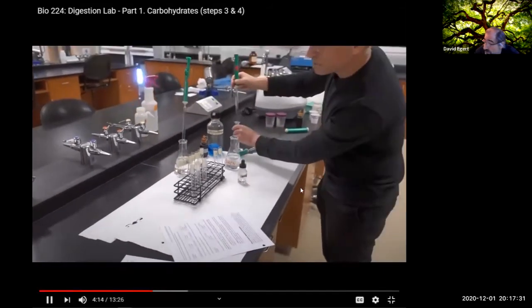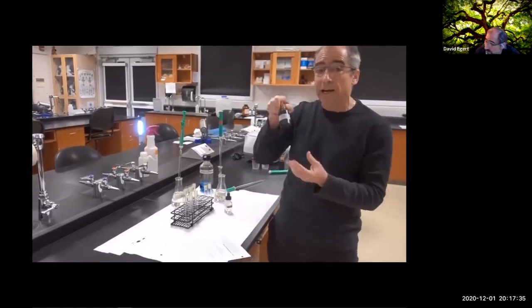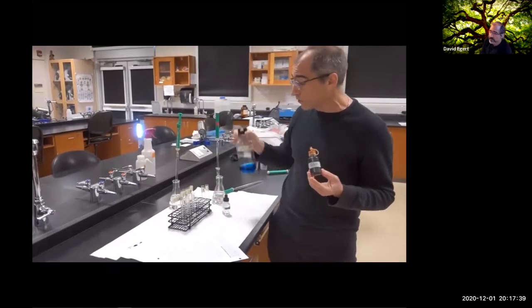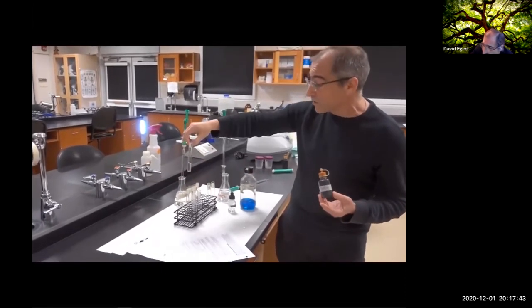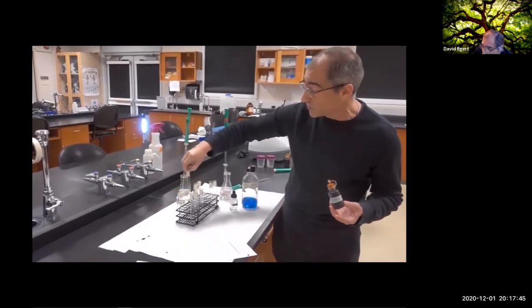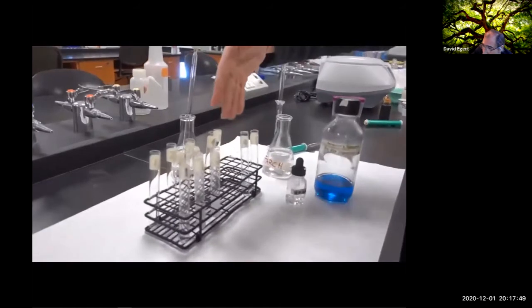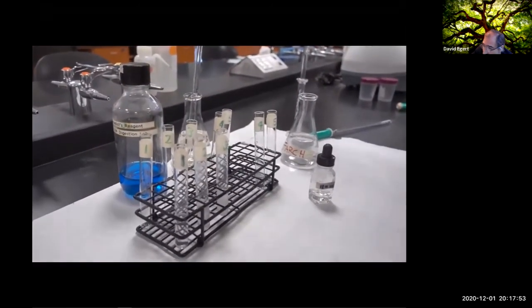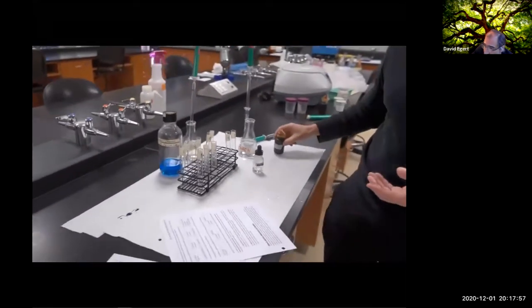It's important to remember, keep it in your mind now, that each of these tubes we're going to be testing both for starch using iodine, as well as testing for the presence of the products of digestion, maltose, which we're going to use Benedict's reagent for. So we're going to be putting these in the incubator. And after we're done, we need to make sure we take each of these tubes and we split it into 2 tubes. That way we can do the iodine test to look for starch in one set, and we can use the Benedict's test on the other side to test for the presence of maltose. If you forget to do this and put your iodine in here without having split it ahead of time, then you're not going to be able to do the test for maltose.